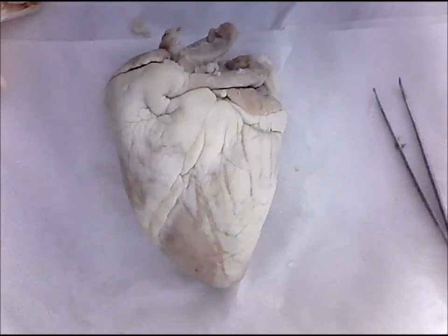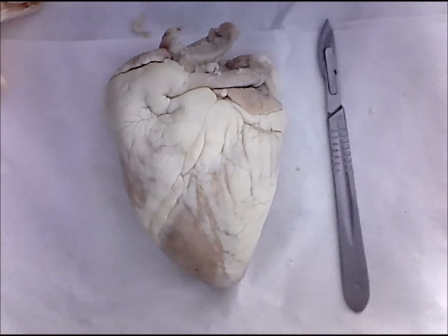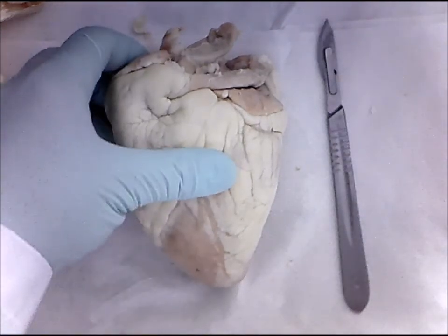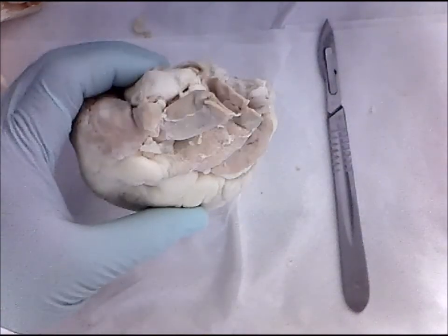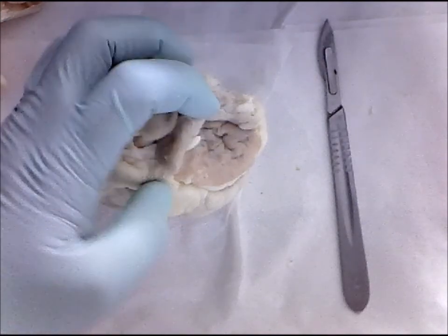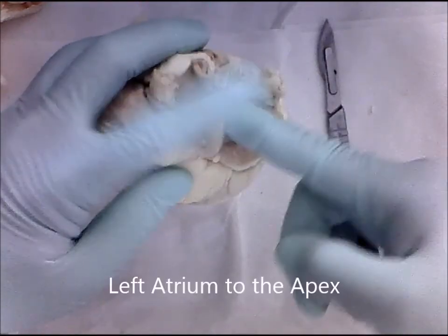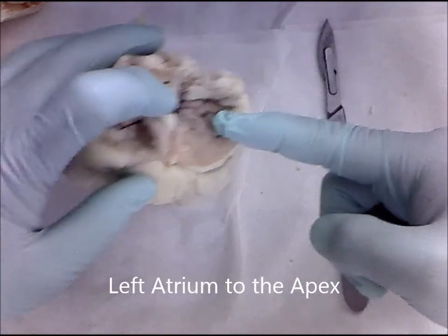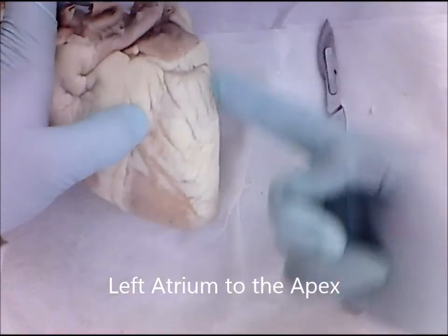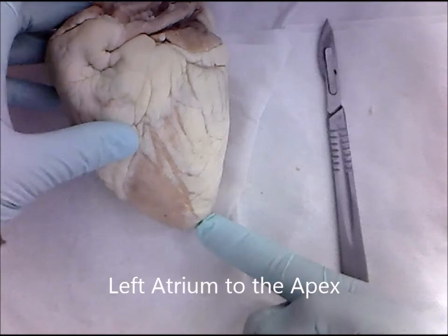To examine the internal structures of the heart, we're going to have to cut the heart into two halves. This requires a scalpel. So, looking at the heart from a superior view, you are going to make an incision through the middle of the left atrium, all the way down the side of the heart, the left side of the heart, to the apex.